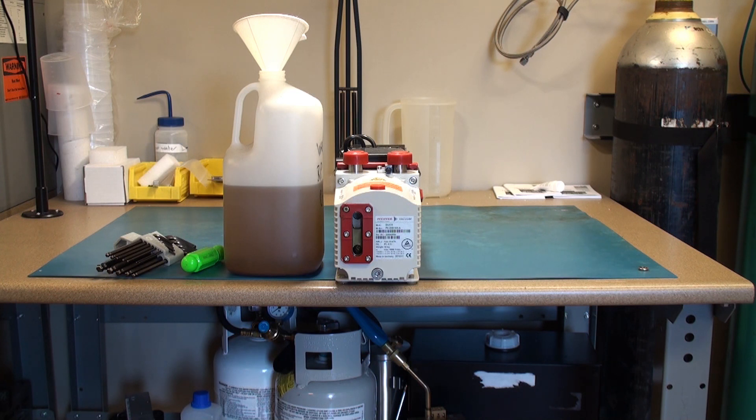Today I'd like to show you a basic oil change on the rotary pump which goes with your sputter coater or evaporator.